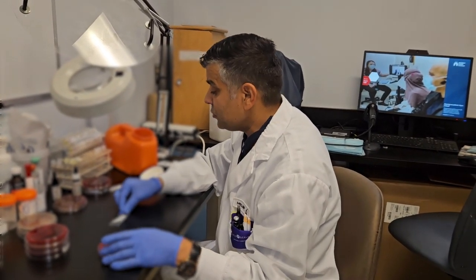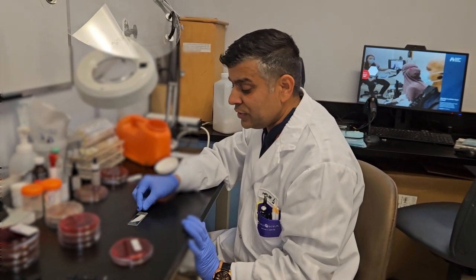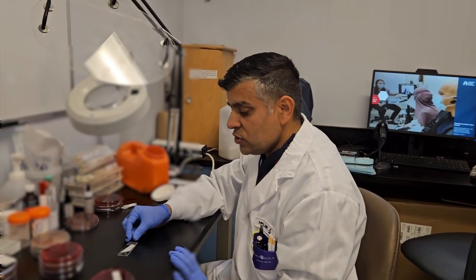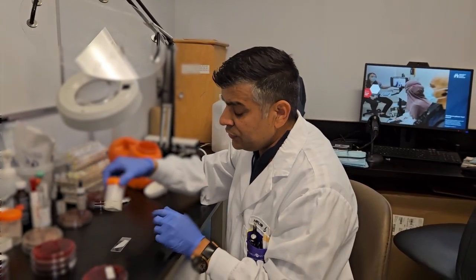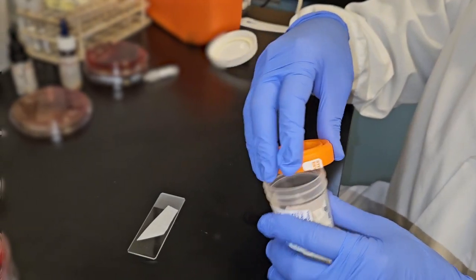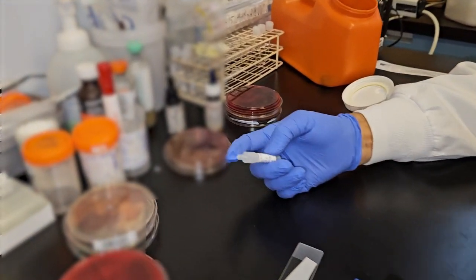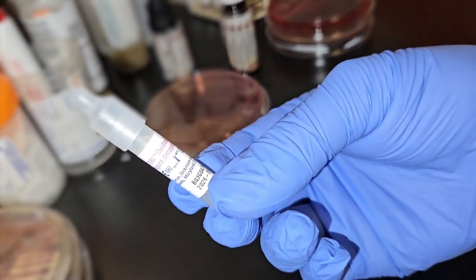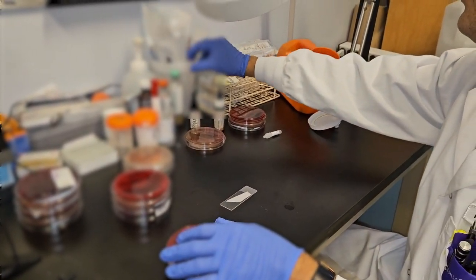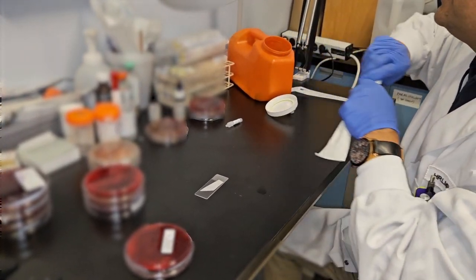To do that, you need an oxidase reagent, which I'm going to use on filter paper on the slide. This is the filter paper and slide method. What I did before was take one filter paper strip and put it on the surface of the slide, and drop a solution of oxidase reagent onto my filter paper. I'm allowing it to dry a little so that I can see my results easily.